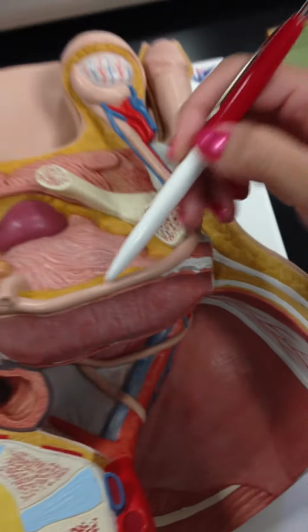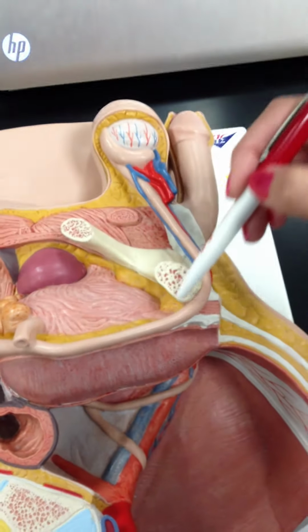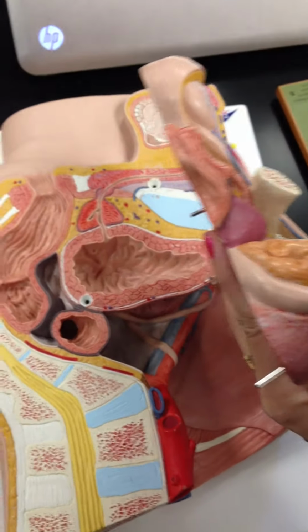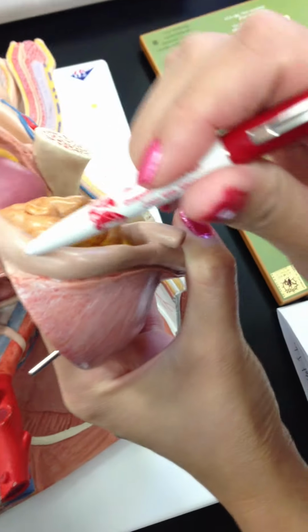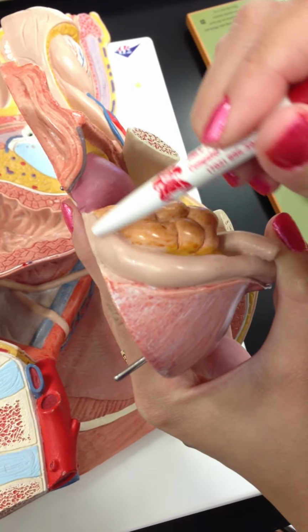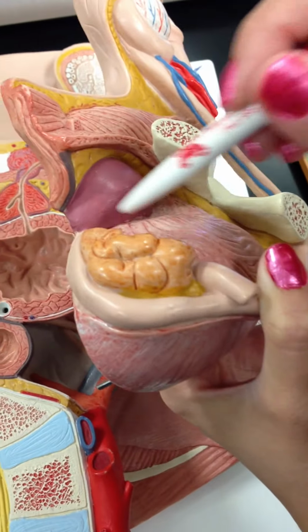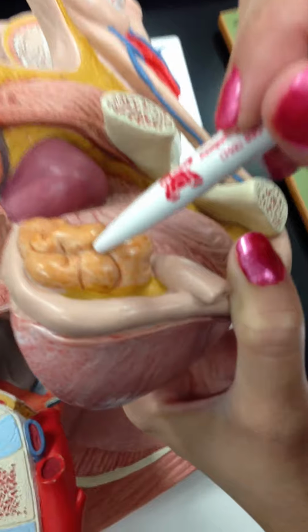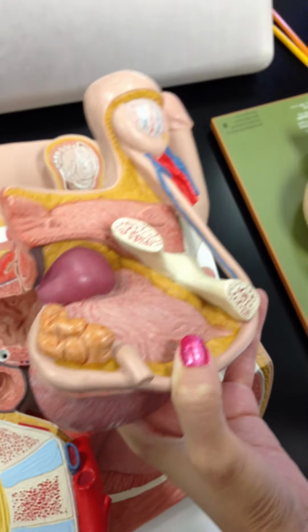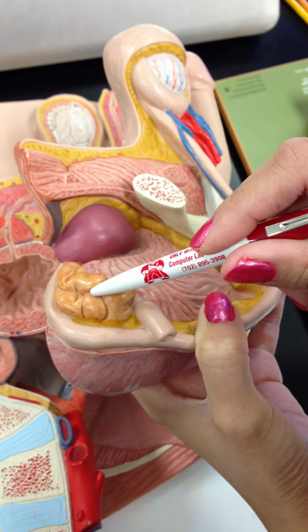The vas deferens is this long string-like structure. And then you can find your way, once the vas deferens widens, it becomes the ampulla. Then the ampulla goes into the seminal vesicles. It looks like a fatty-like structure on this. And then, what's next for 7-Up after seminal vesicle?